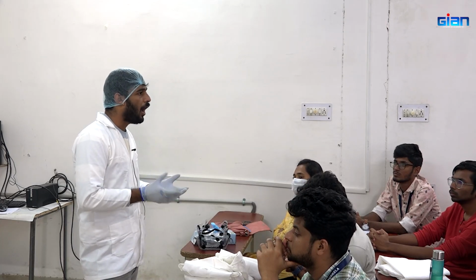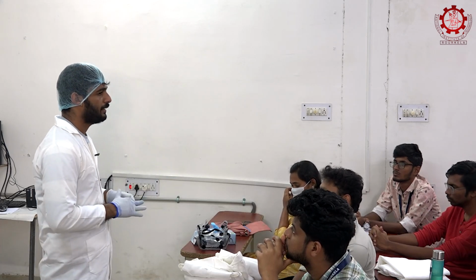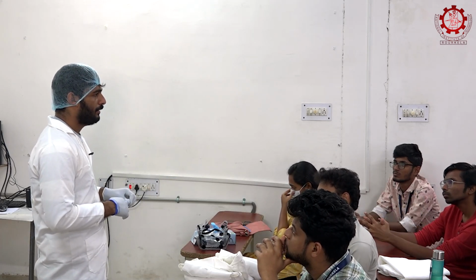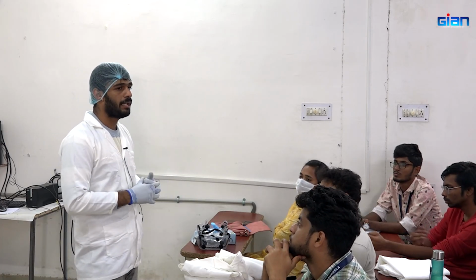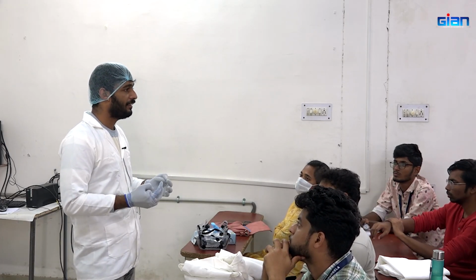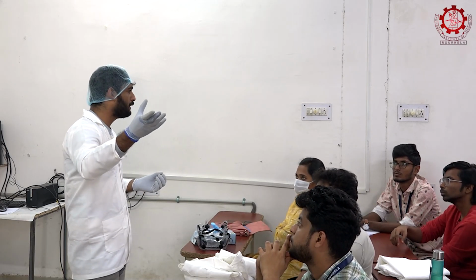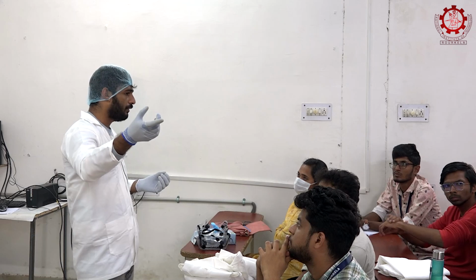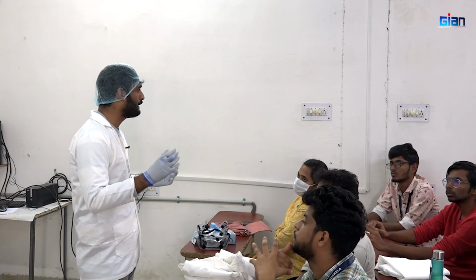Whenever we are adding acid to any shell, how can we say that it is completely demineralized? For example, it's a hard shell. When we are adding acid, how can we say it's demineralized? Any idea? It becomes softer. Okay. I will show you the original one and how it has changed. It becomes so flexible because chitin is flexible in nature.